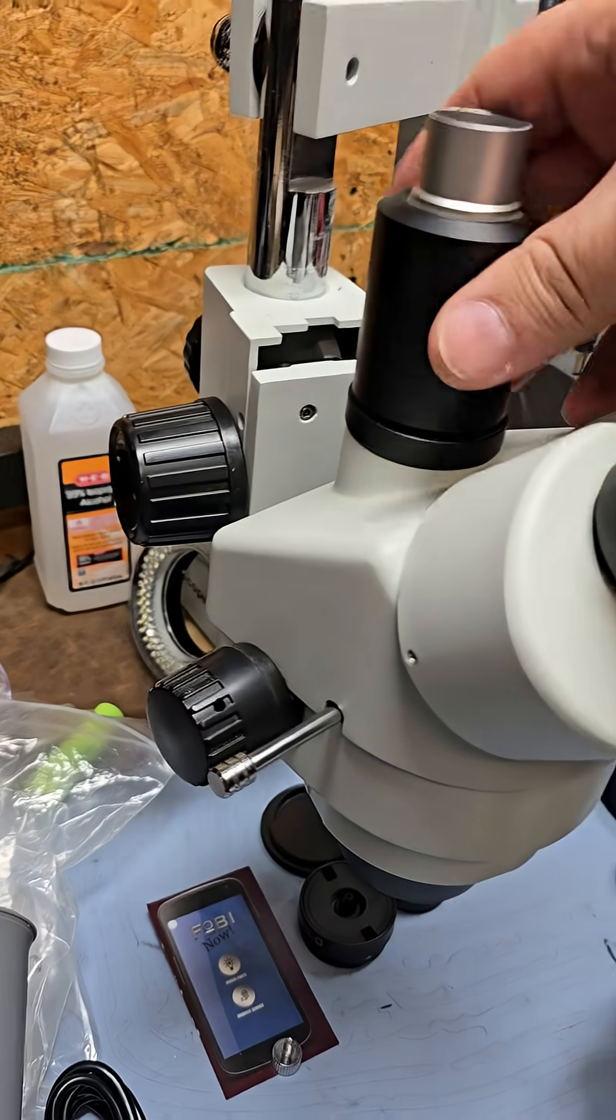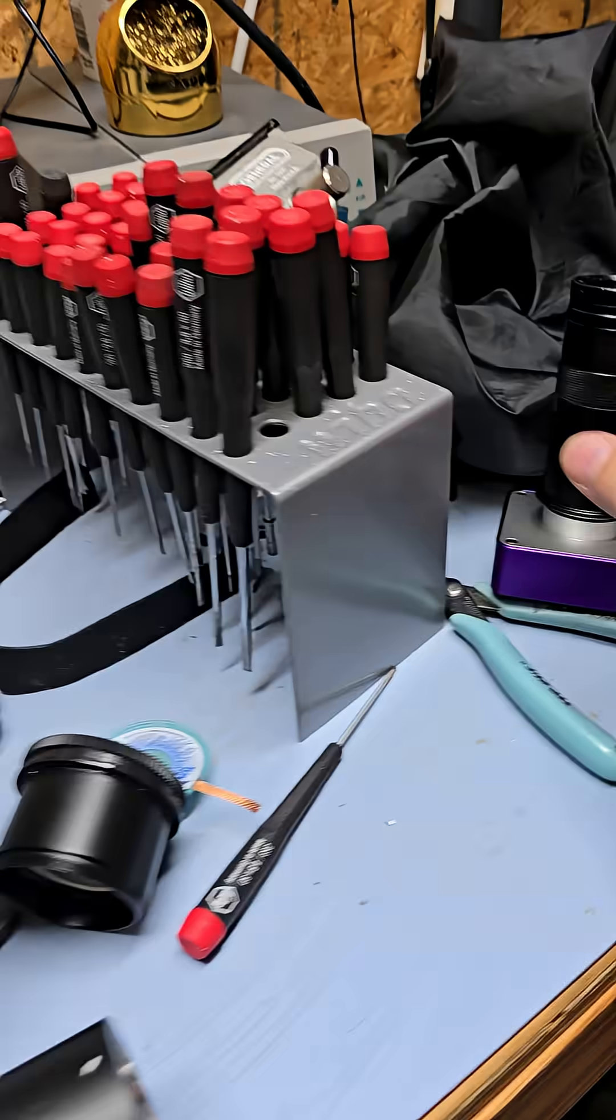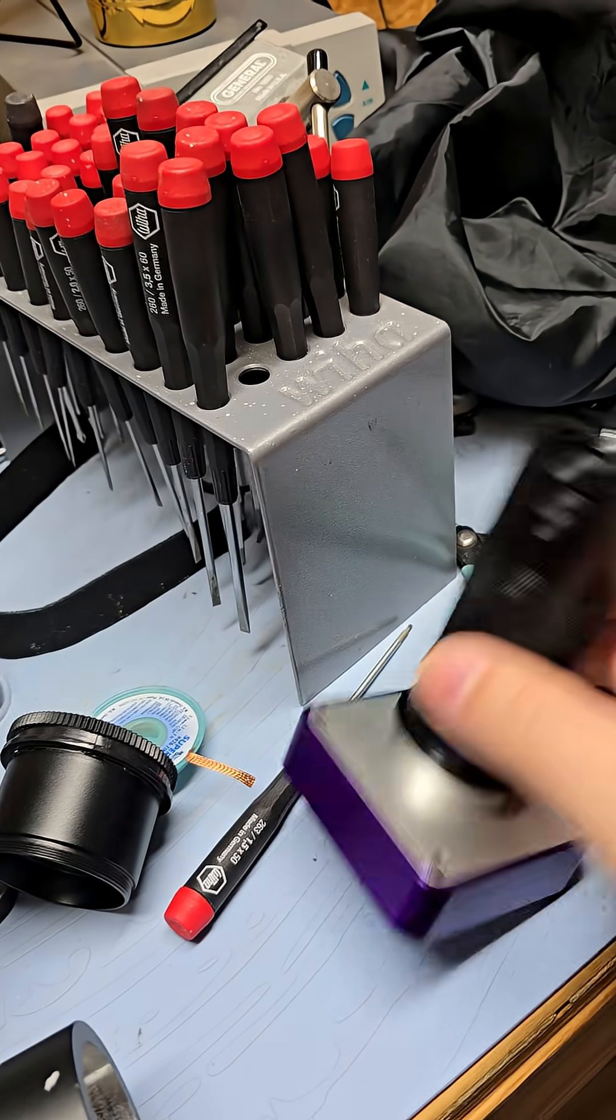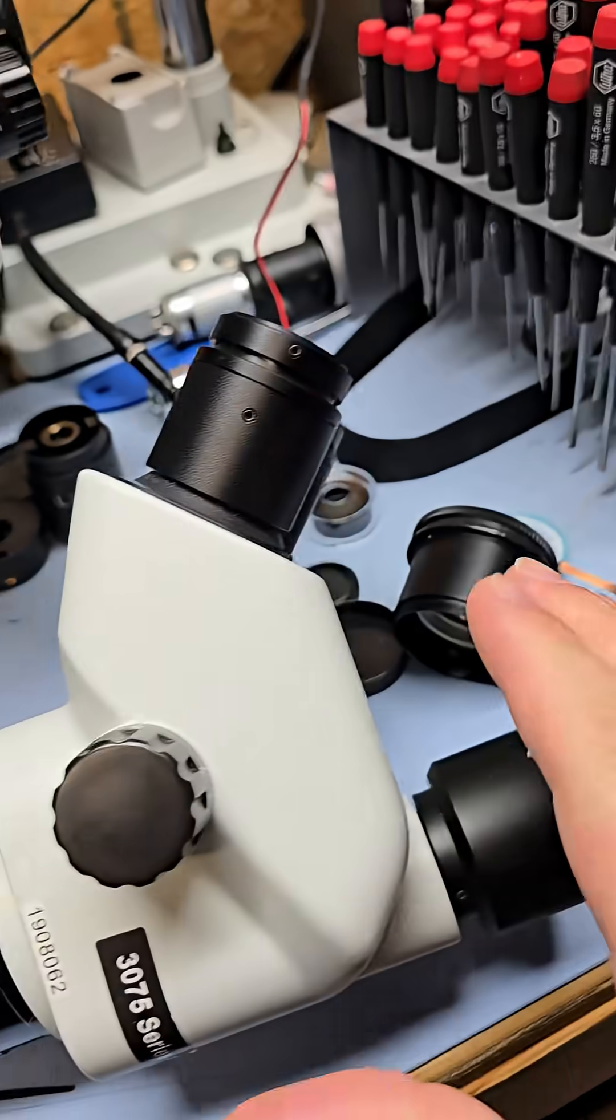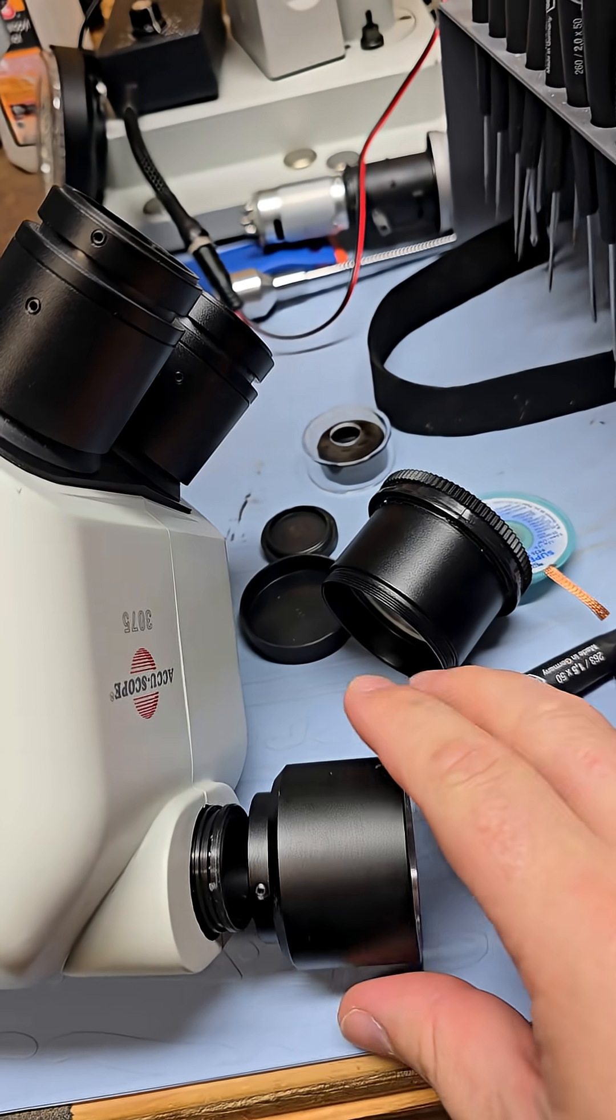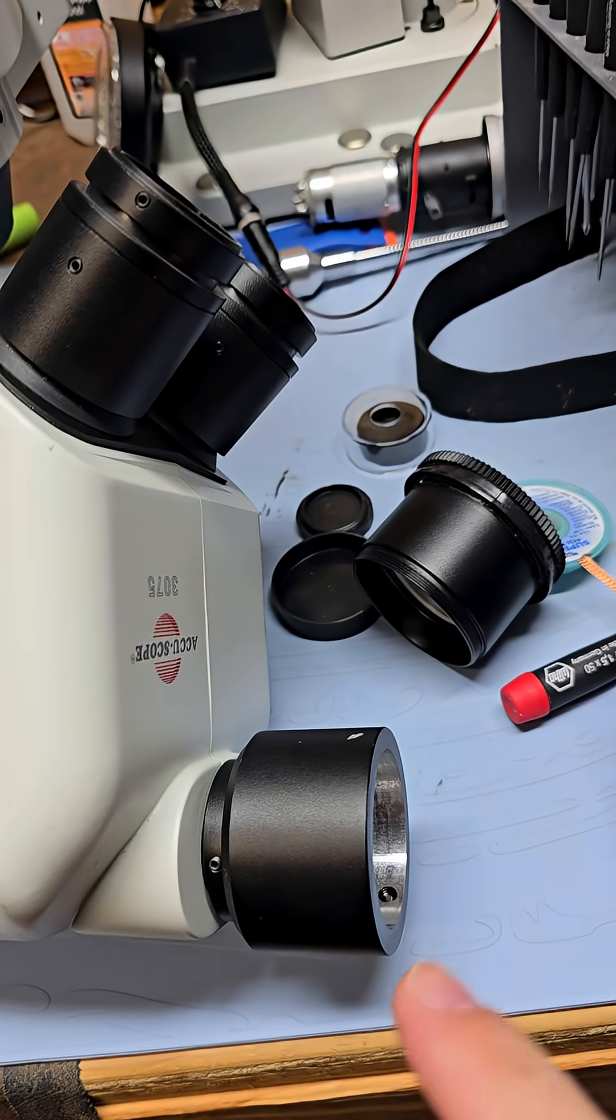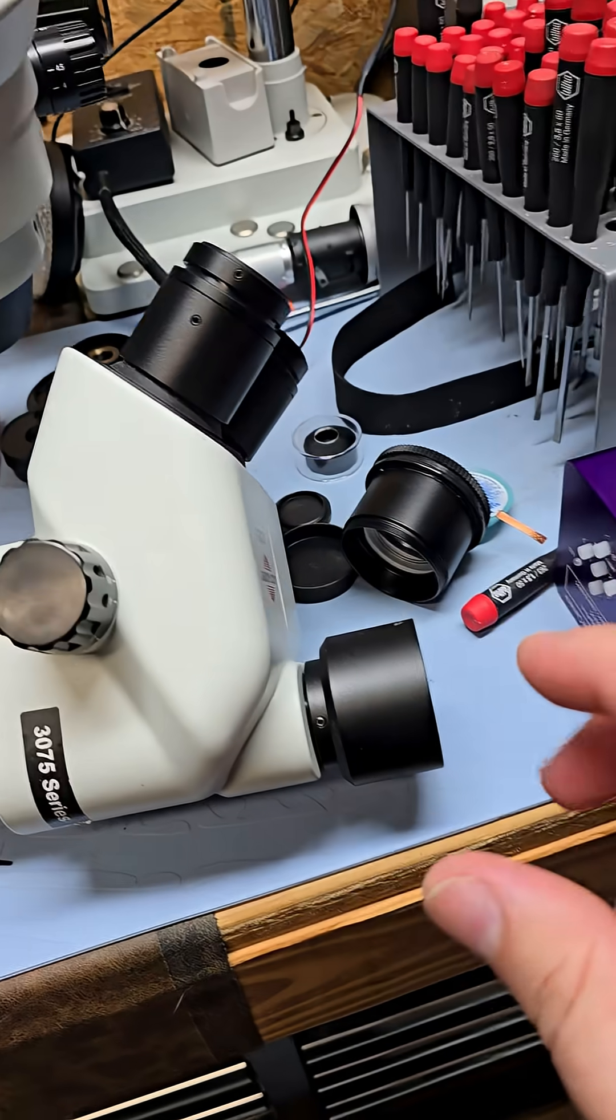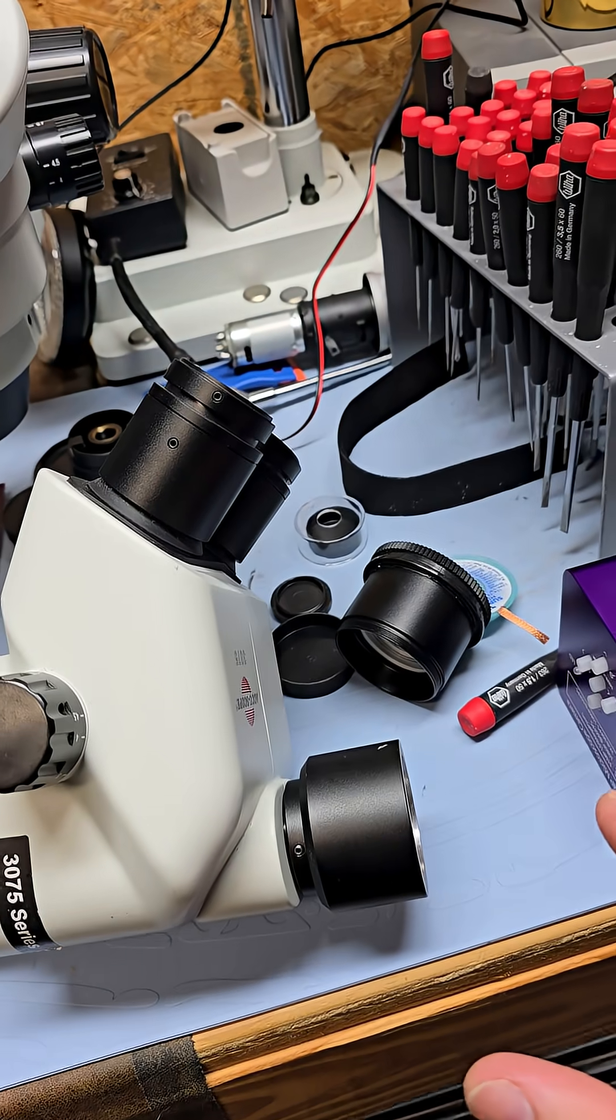I want to mount a camera up there and I've got cameras. I've got a nice camera here and for most scopes, this mount right here, it was meant to fall off, is called a C-mount. That's what it's supposed to be at the top of microscopes.